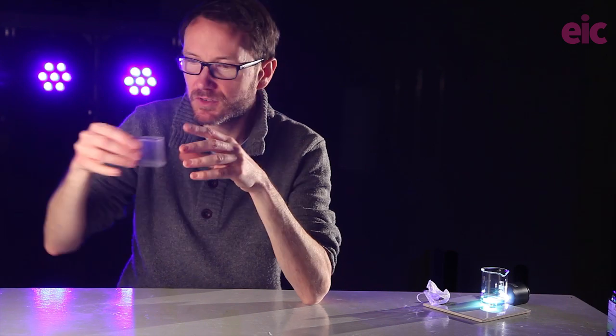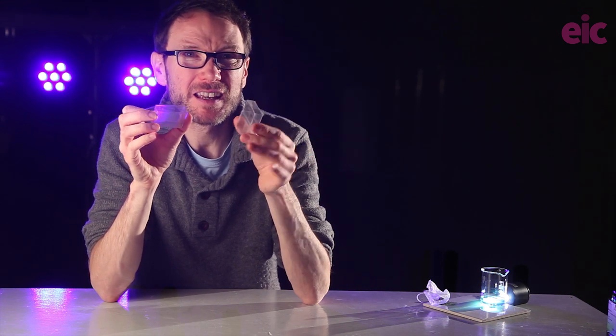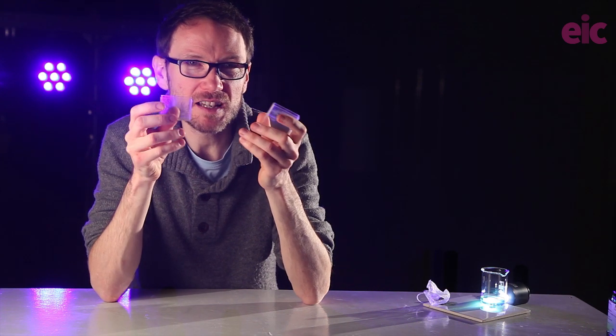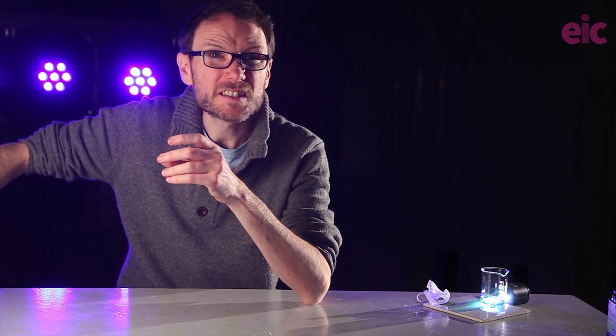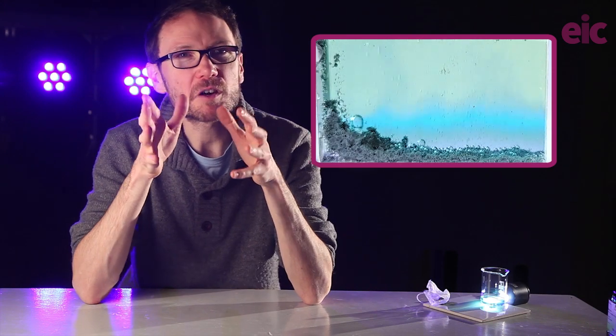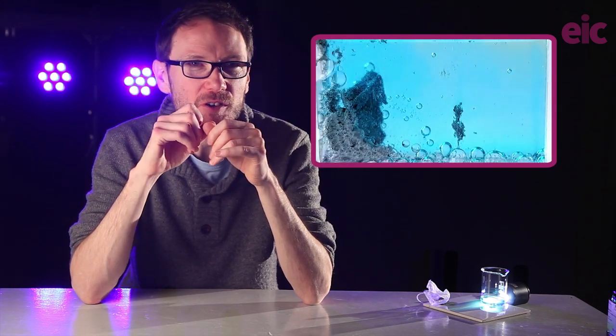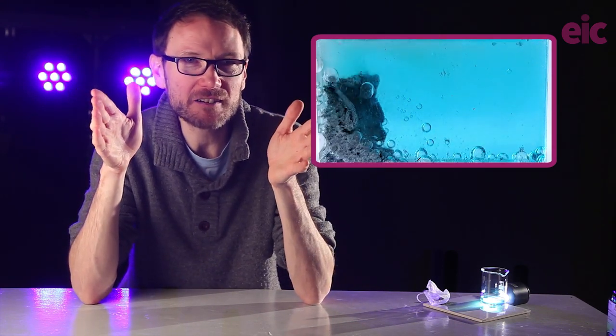Earlier on, we saw a trial that I ran using a casing from strips of indicator paper, a bit like this, and I was thinking along multiple lines here at the same time. And the clarity of the color that you get by passing a light through this, compared to a test tube with all of its potential specular highlights and reflections, it's day and night. With this small scale, the dimensions also provide benefits for keeping the cloudiness of powder additions to a minimum. Now, by carefully adding powder onto one side and occasionally brushing it across, I had a reaction running in about 20 minutes. And that maintains some really nice color clarity throughout.